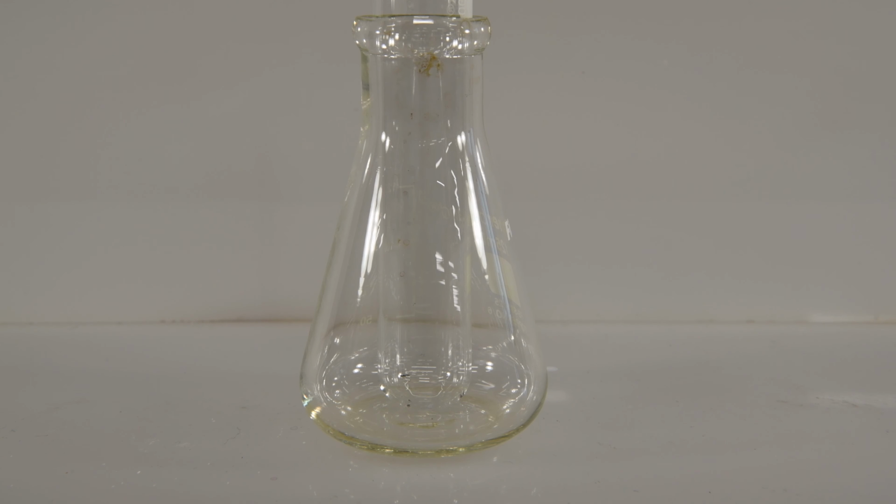As we mentioned in the pre-lab, the reactions we saw with magnesium and calcium could have been caused by the excess hydrochloric acid that we had in our first two beakers. So to test that and be sure that wasn't the case, we're going to carry out a reaction between sodium carbonate and hydrochloric acid directly.